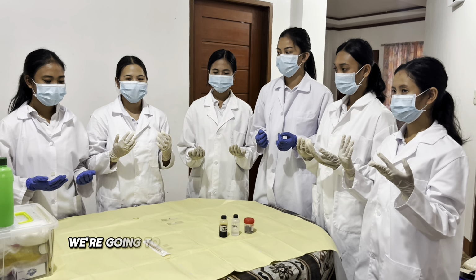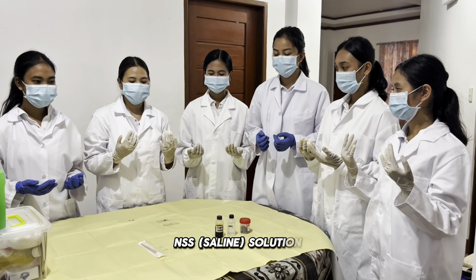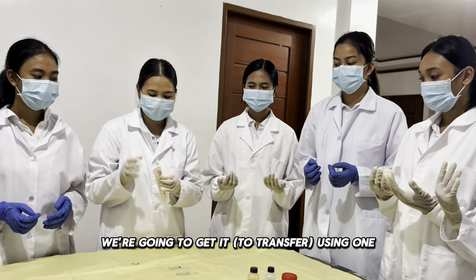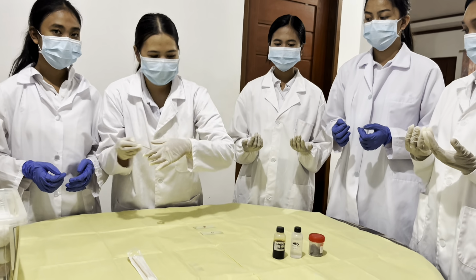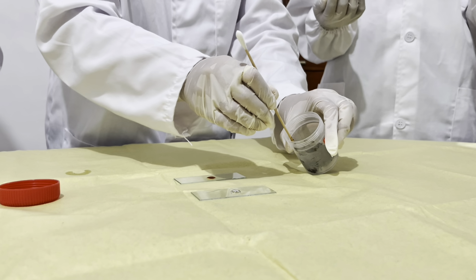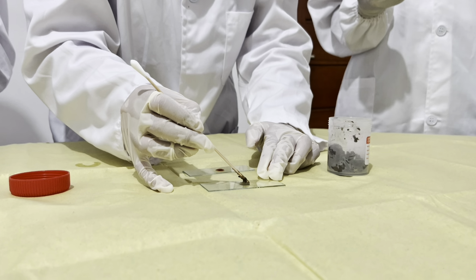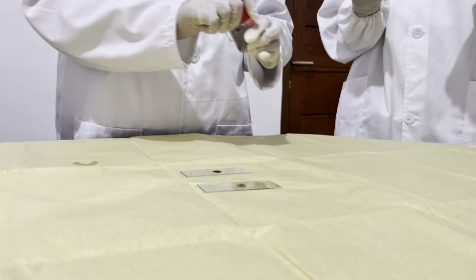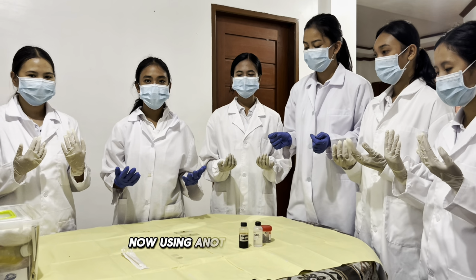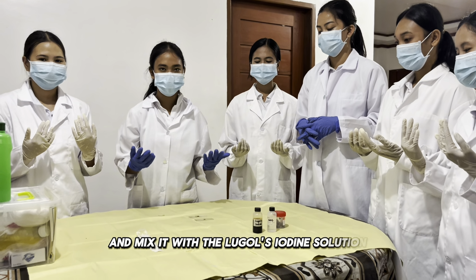Next, we're going to put a small amount of the stool sample on the NSS solution. So using a sterile swab applicator, we're going to use one. Now, using another applicator stick, we're going to get another sample and mix it with the Lugol's iodine solution.